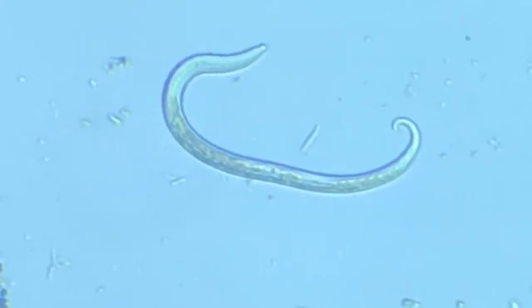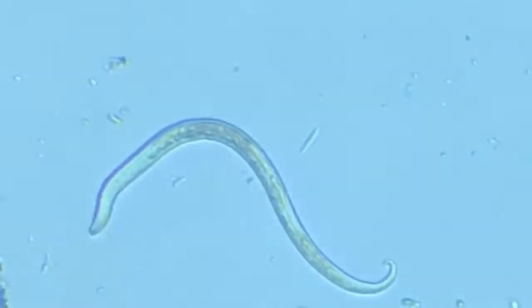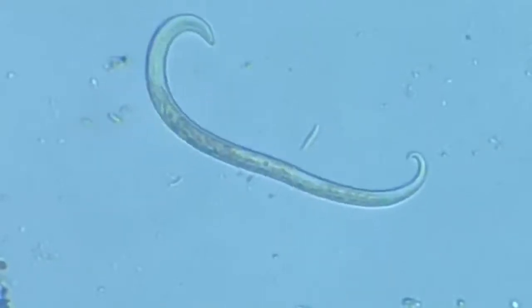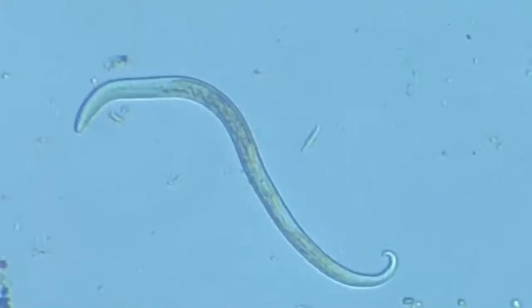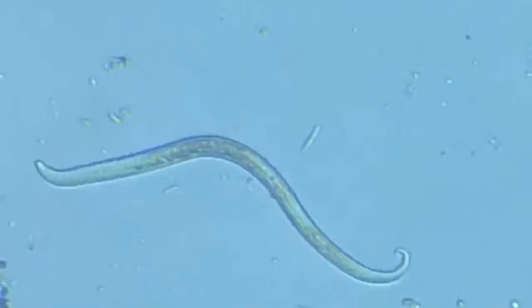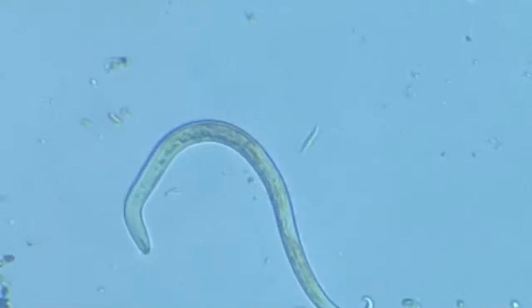Then we see that the body is very smooth and double layered. That shows that there is an outer layer, there is an inner layer. Those are not two different layers. In fact, there is this outer layer, which is the pellicle or the skin, epidermis, and the inner tube, the intestinal and the alimentary canal tube, which are separated by a small space, the pseudocoel.